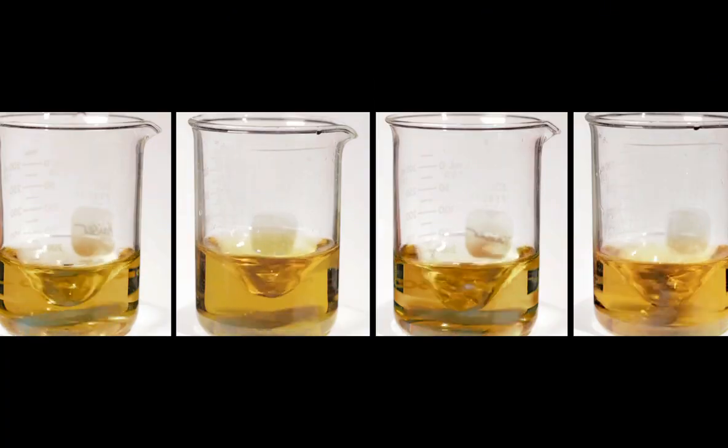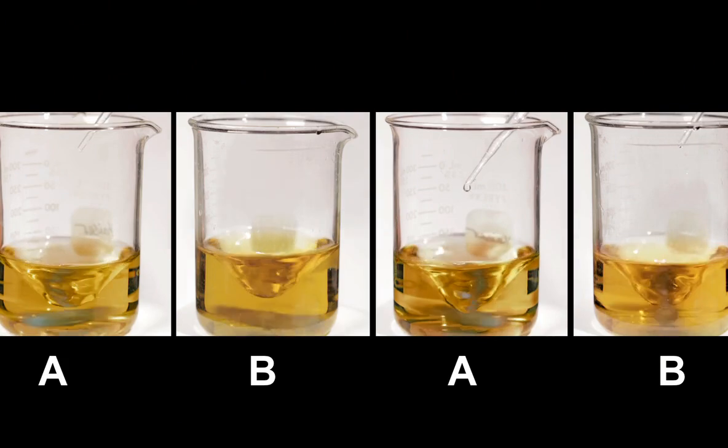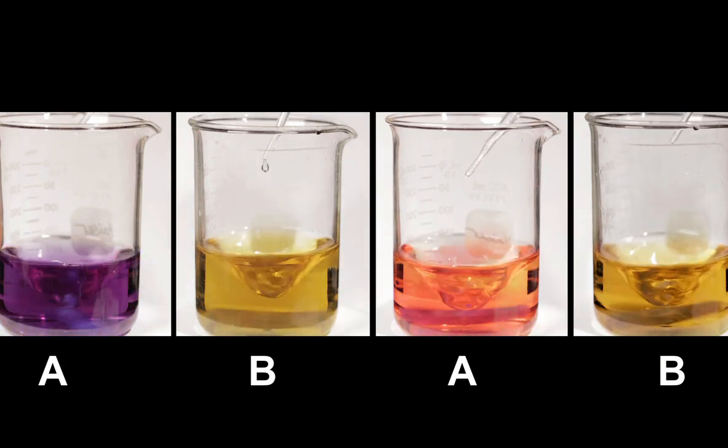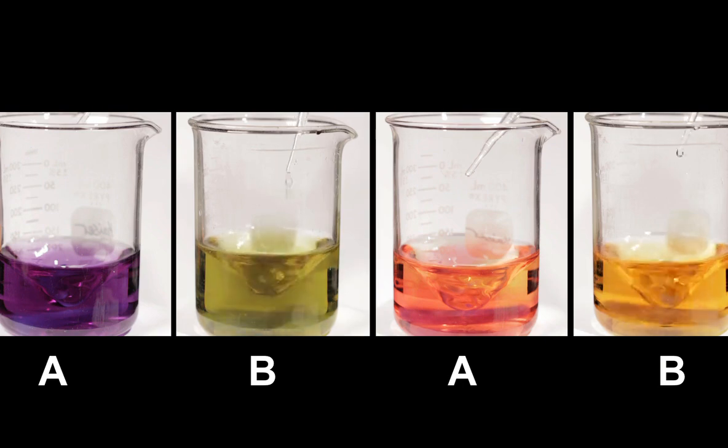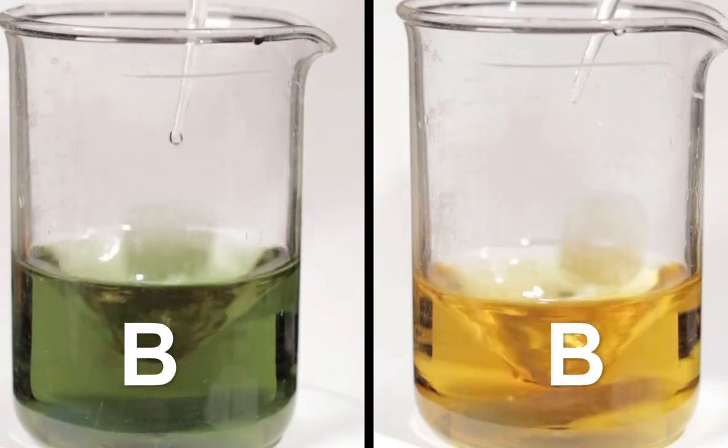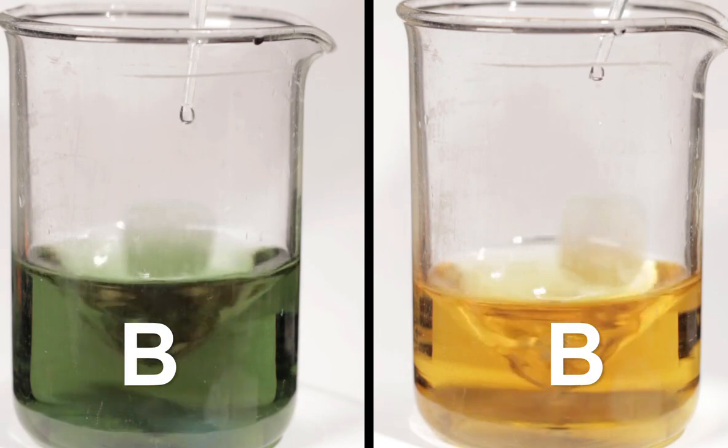Let's look at our pairs of solutions. When we added a strong acid or base to solution A, its pH changed dramatically after just one drop. When we added one drop of acid or base to solution B, its pH stayed the same. Let's add more acid and more base to solution B and see what happens.